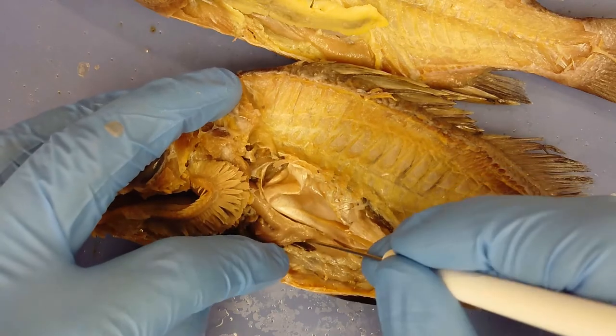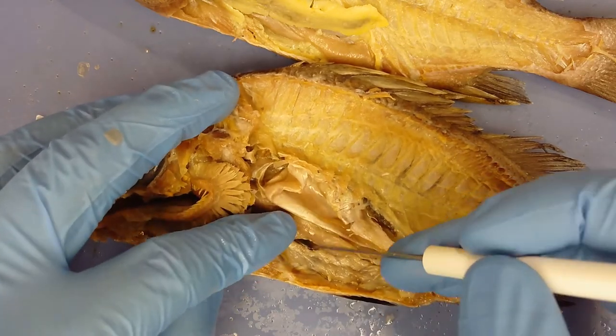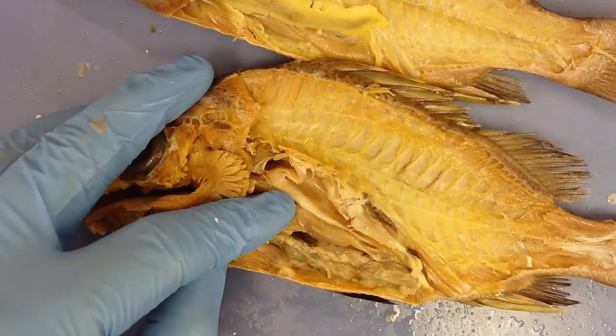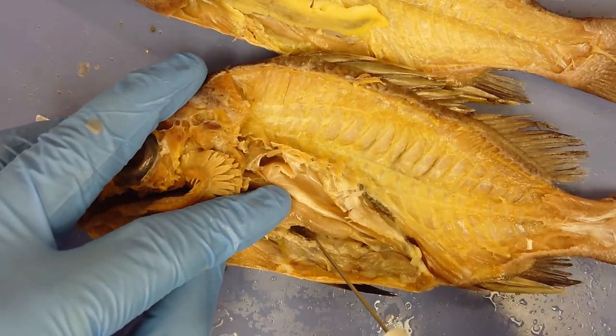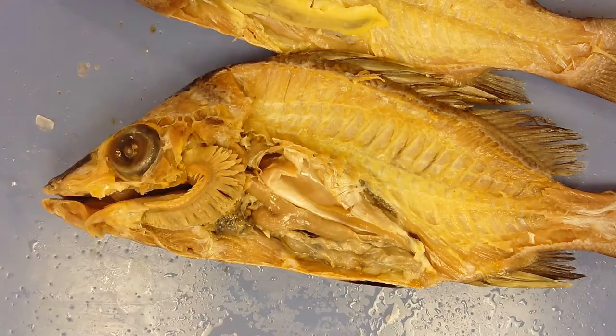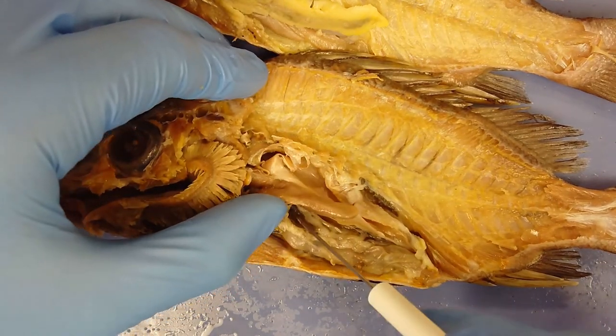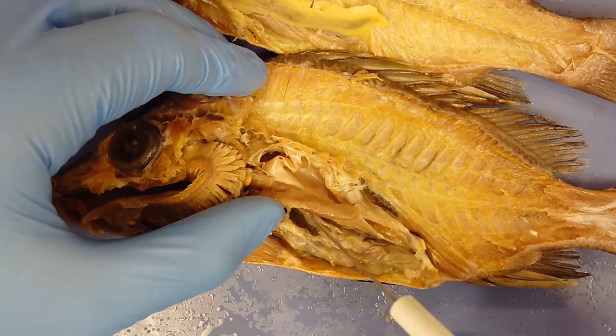This really dark colored structure is the spleen, which sits right underneath the stomach. It acts as a filter for the blood and is also where erythrocytes — red blood cells — are created.